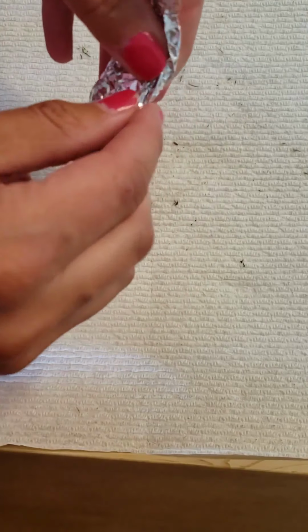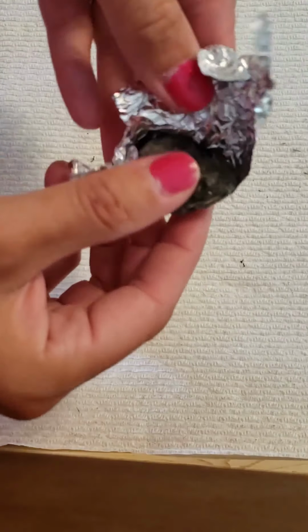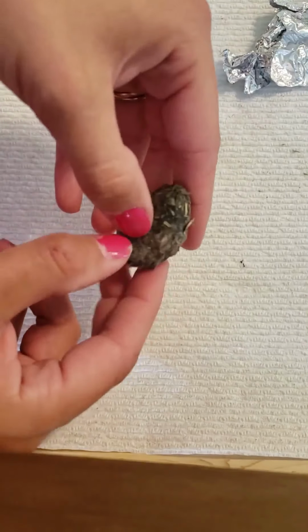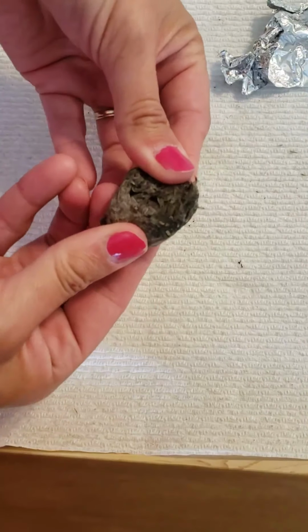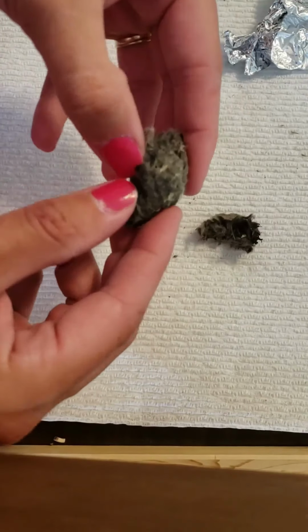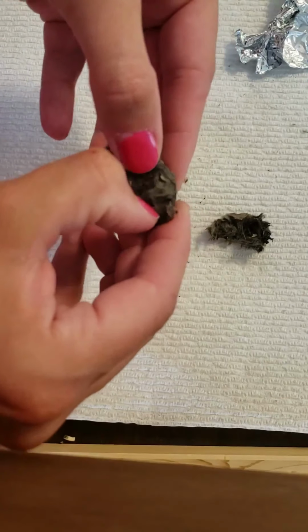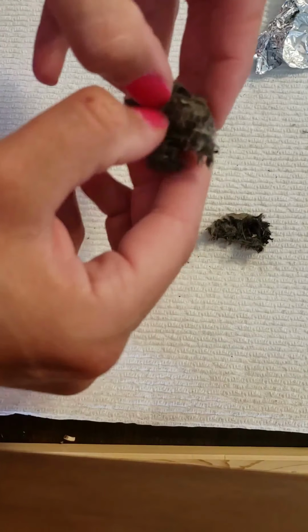And if I can find where the foil opens. This one's a little smaller, so we might not find as much. So here we go. I'm just gonna try to break it in half or so, try to get all that yucky fur. I mean, this whole thing is kind of yucky, but you know, it's science. I think it's so cool. Did you break it? No, I didn't break anything.